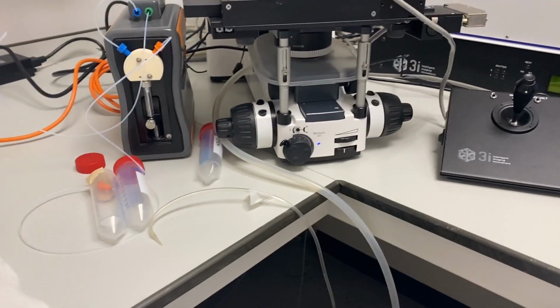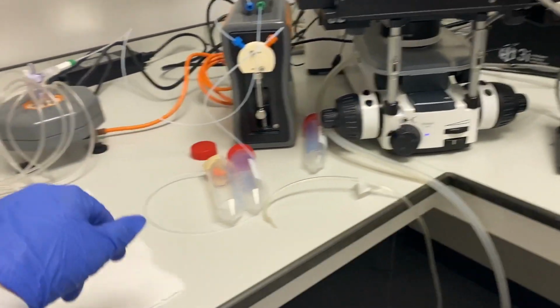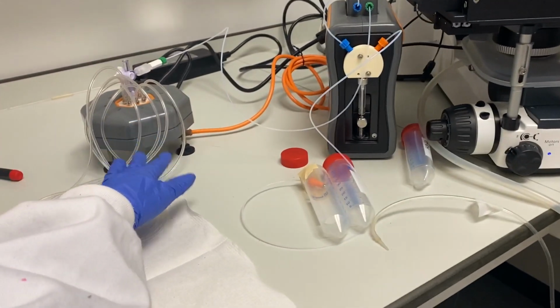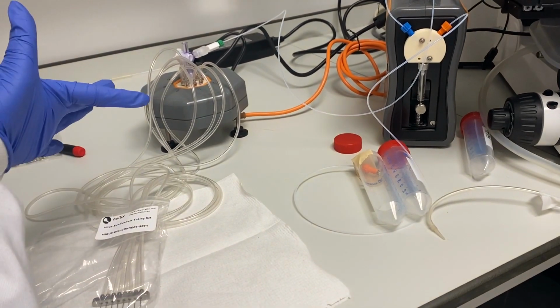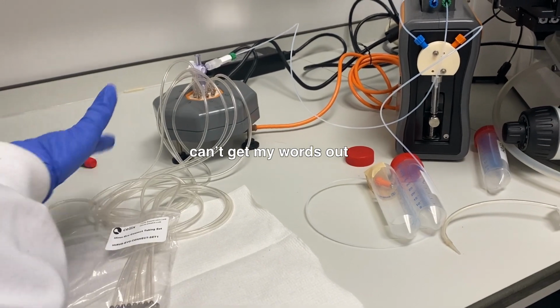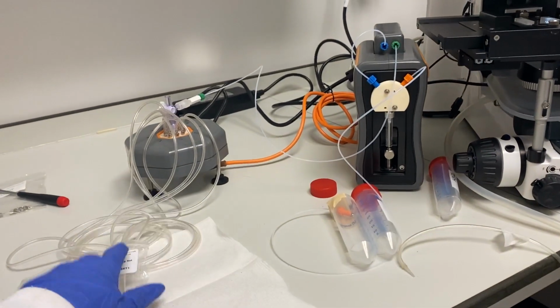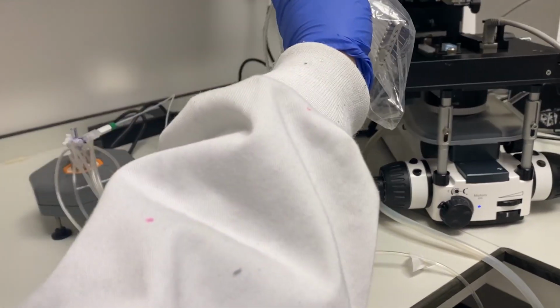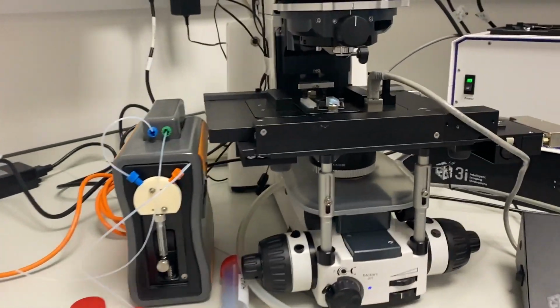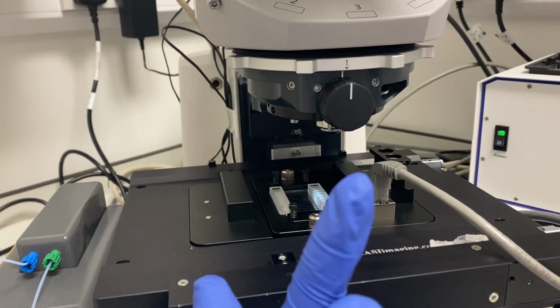So it looks horrific. This is the pump. This is the Evo pump. So this is all connected, and this then goes into the chip here. But this is meant to be the other way around.